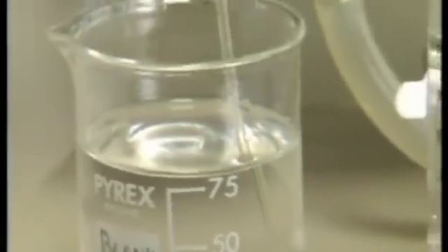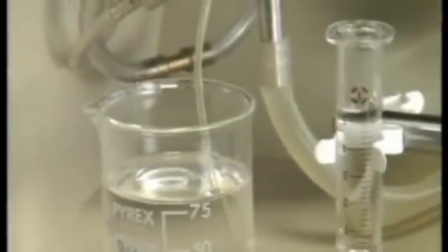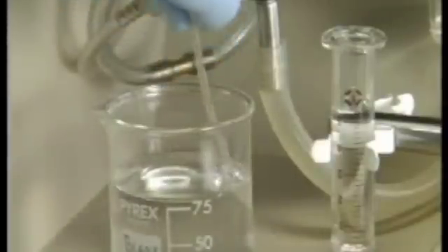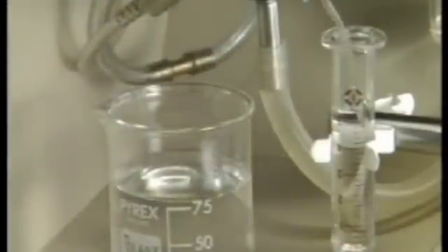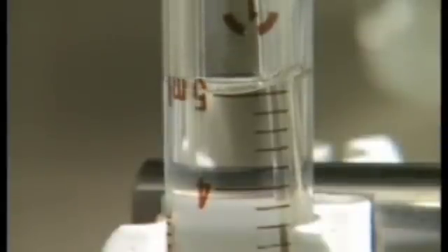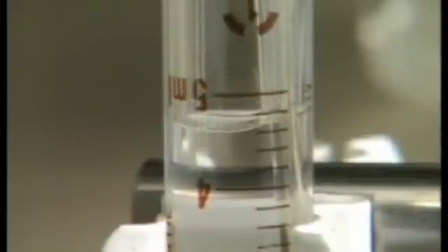The rate at which the instrument draws up liquid, the aspiration rate, should be checked using a blank solution, in this case water, at the beginning of a run. This is easily done by drawing the solution from a graduated vessel. A rate of 1 cubic centimeter in about 10 seconds is satisfactory.